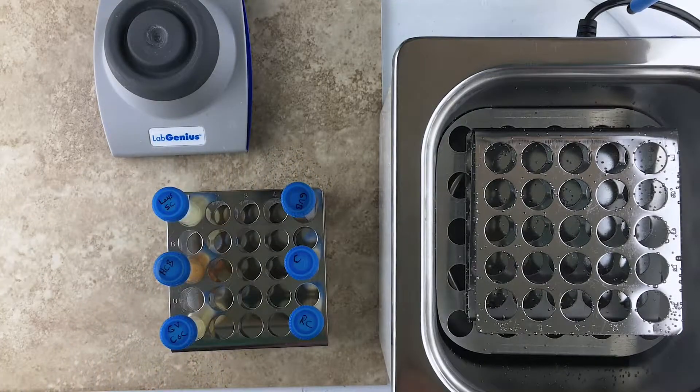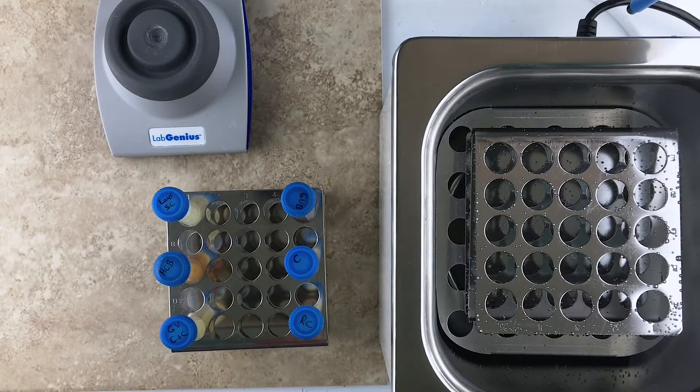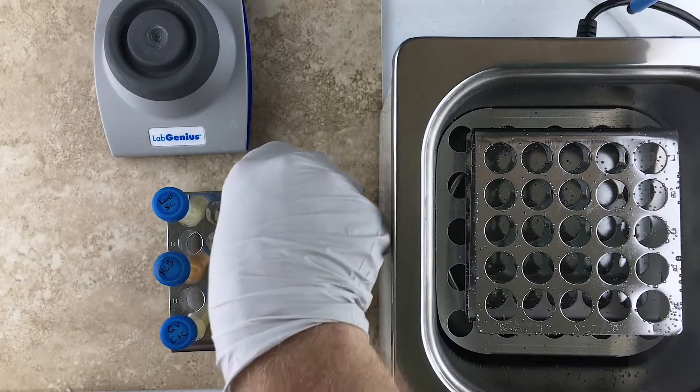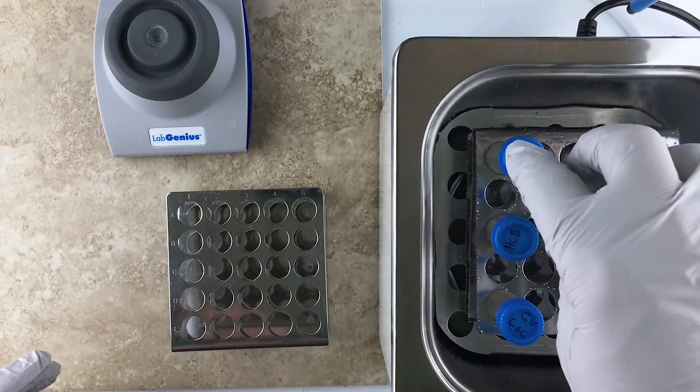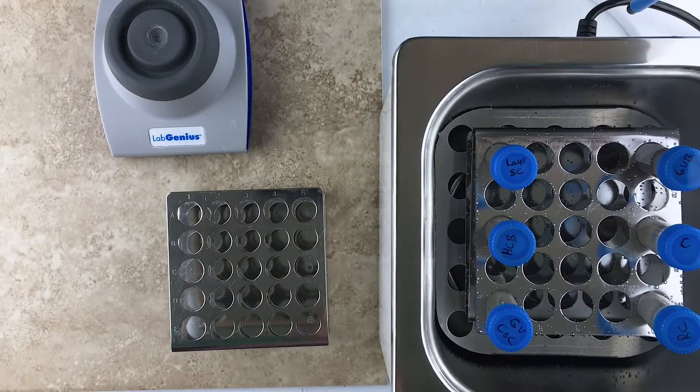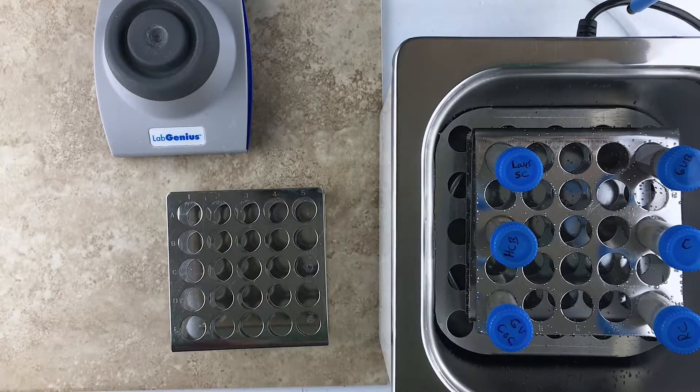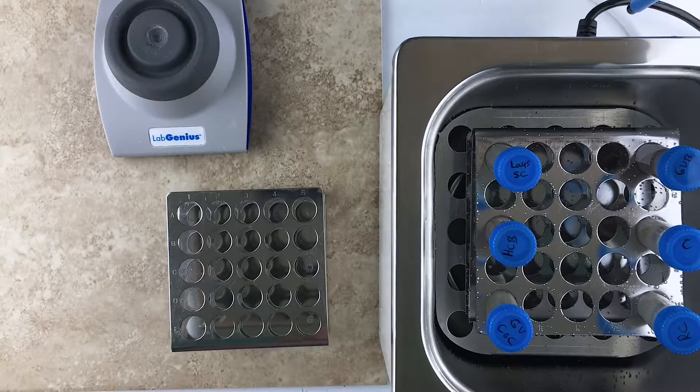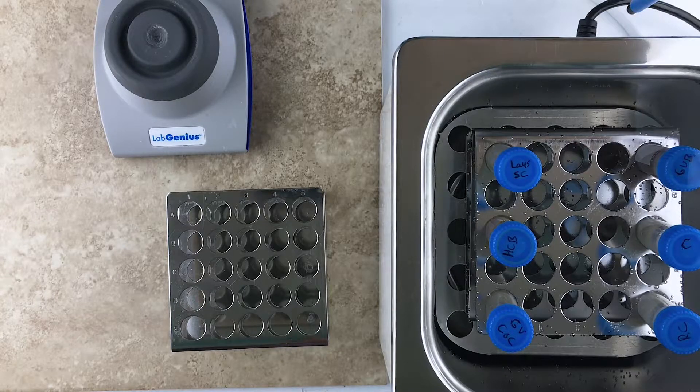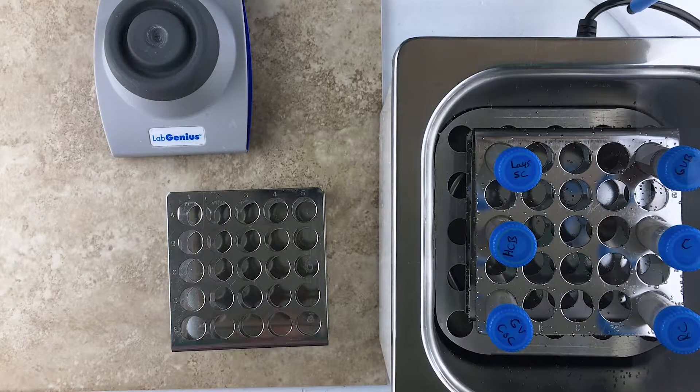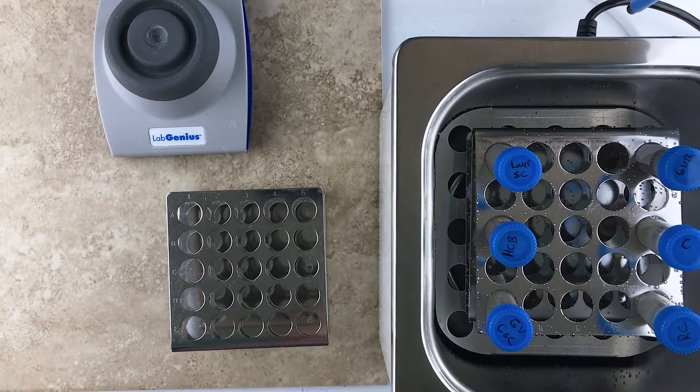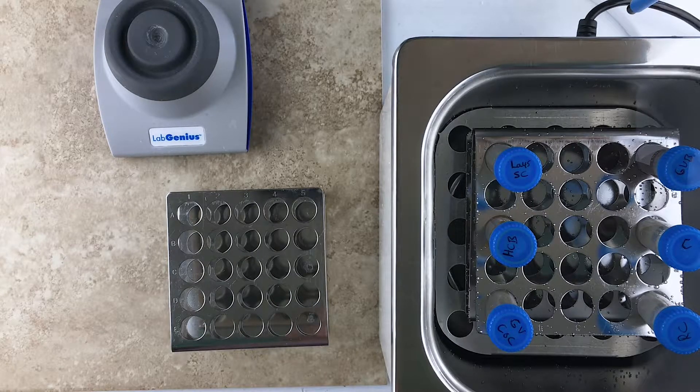Now I am putting multiple samples in just because that's more efficient. I'm going to do six at a time. So these need to incubate in this hot water bath for about 40 minutes at 50 degrees Celsius. I'm going to come back periodically and vortex all of the samples and then we'll proceed from there.